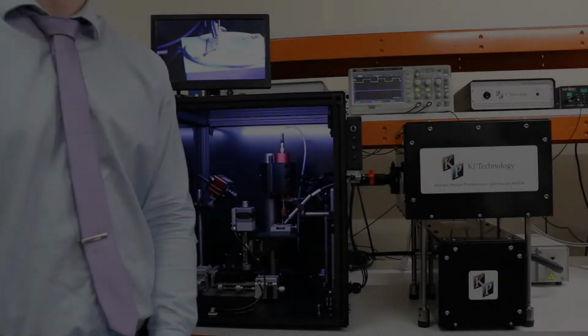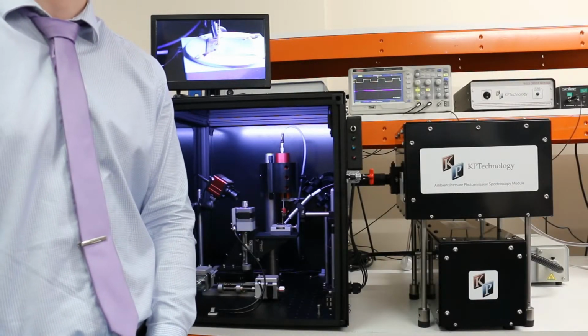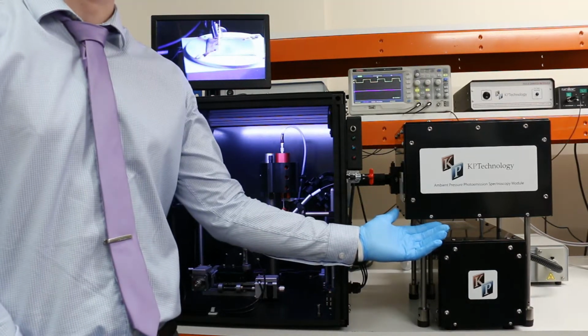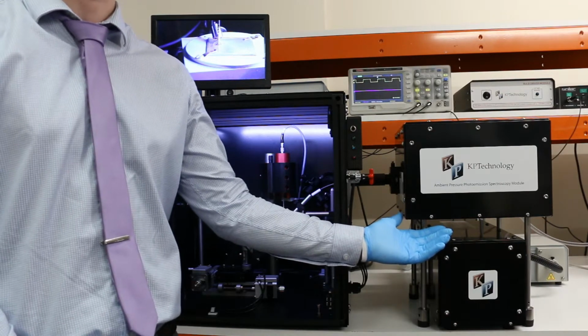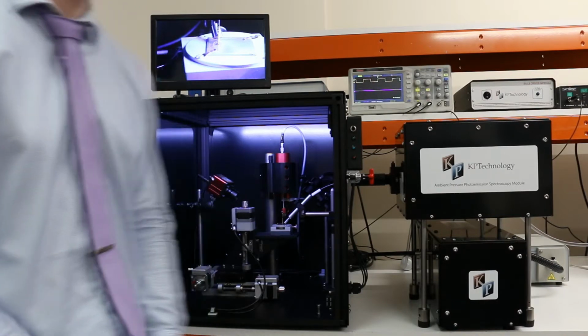This video is going to cover how to carry out an APS measurement on the silver sample that comes with all APS systems. First, we start with purging the APS module with 99.998% pure nitrogen gas at an initial flow rate of 5 litres per minute.